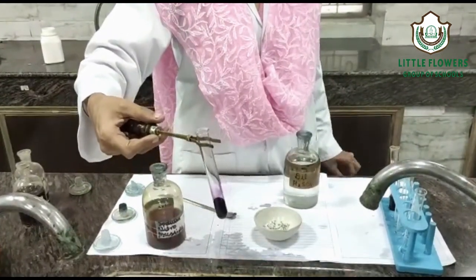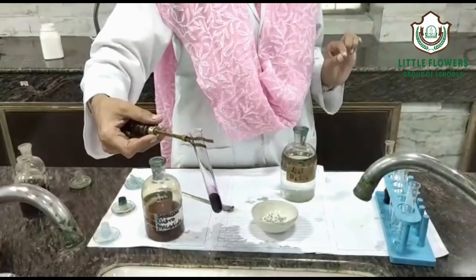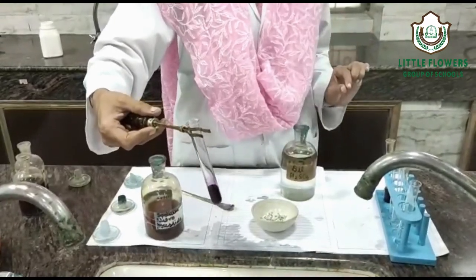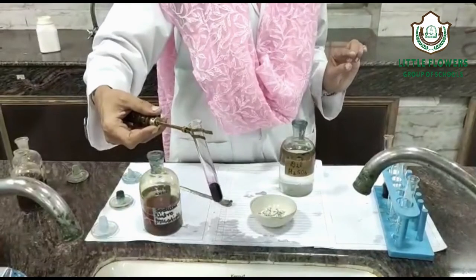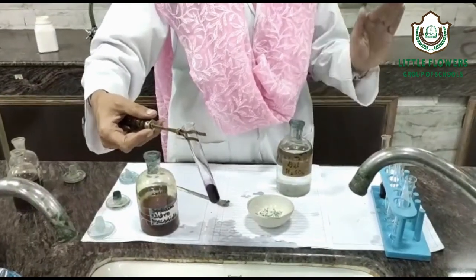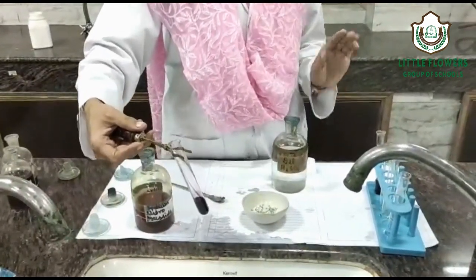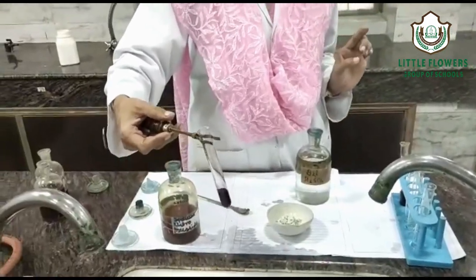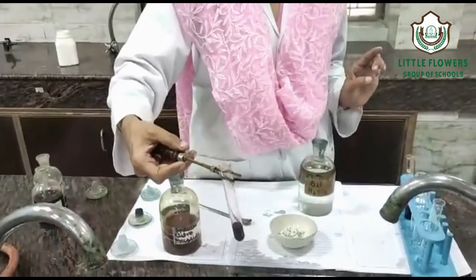The result is: in the given salt, the S²⁻ acidic radical is present. This way we have completed the two-fold test for two acidic radicals — the first is complete, and the second one confirmed is sulfide.